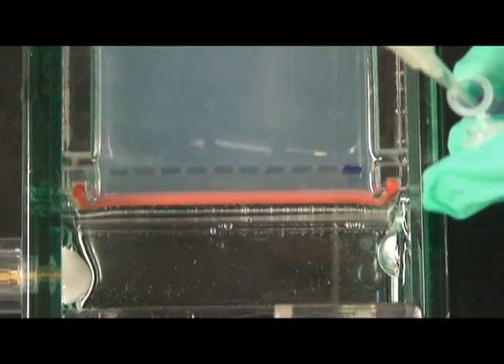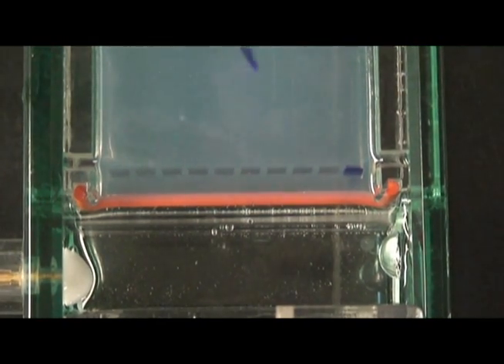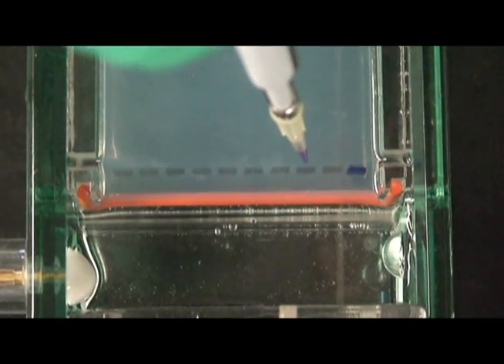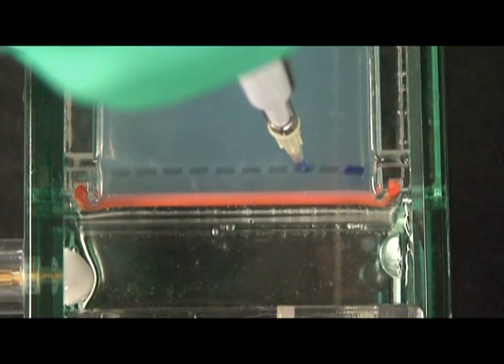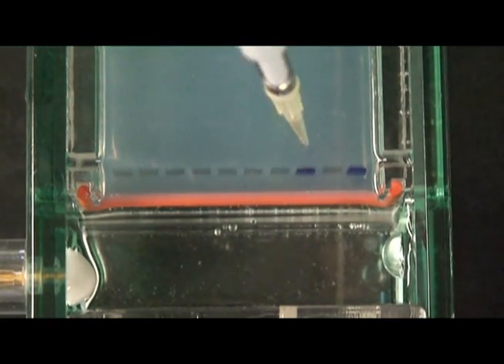Remember to record which sample is placed into each well. If possible, space the samples a well apart. This will limit the possibility of contamination and make the gel easier to read.